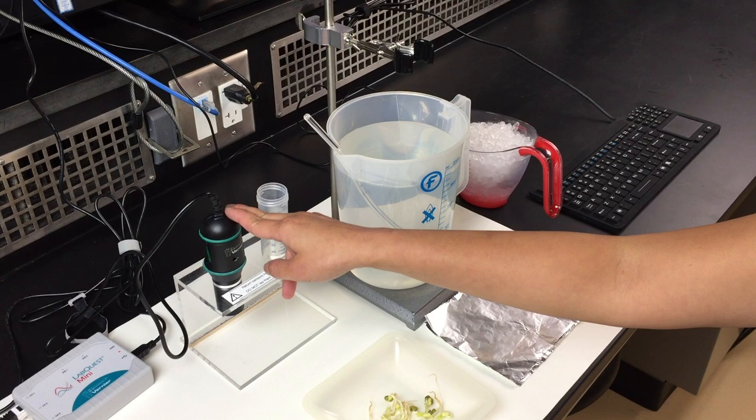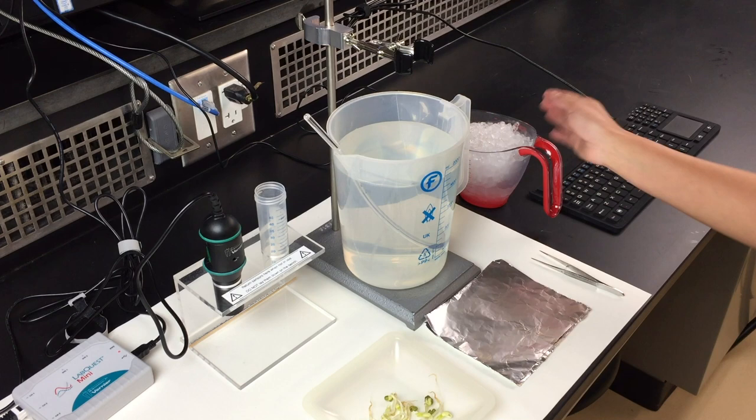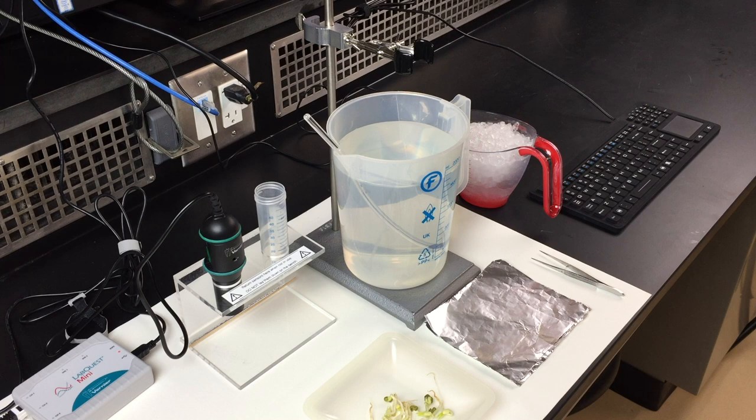For this experiment, we will need a LabQuest Mini, an oxygen sensor, a biochamber, your water bath, some ice for temperature adjustments, and of course the mung beans.